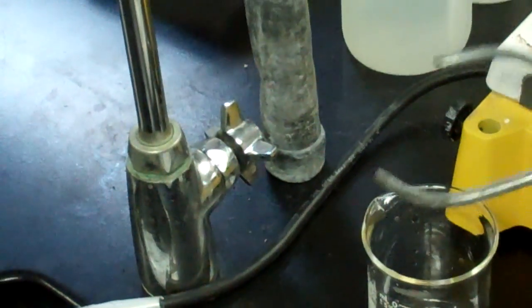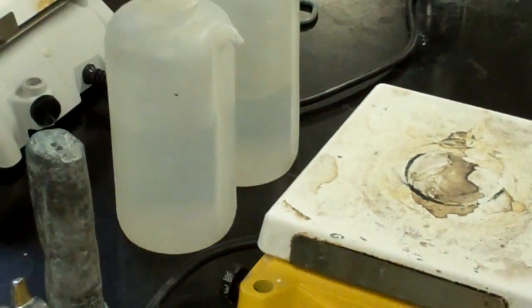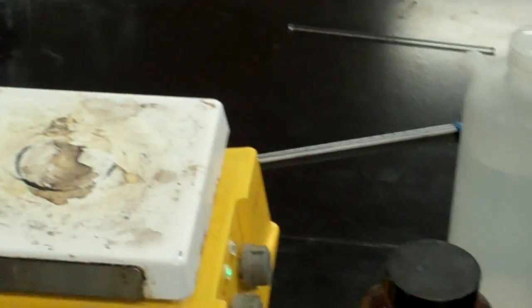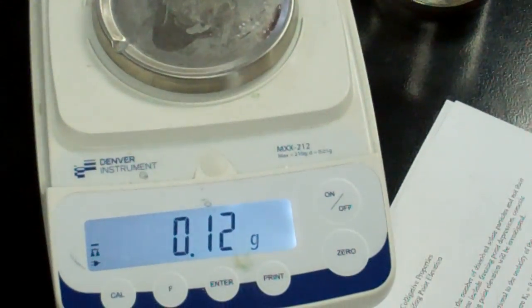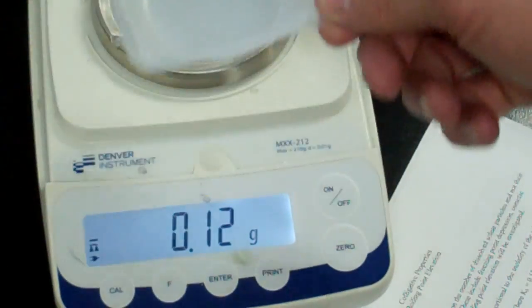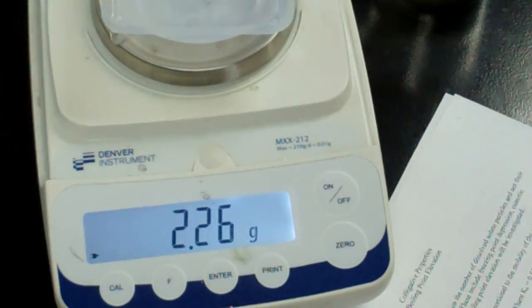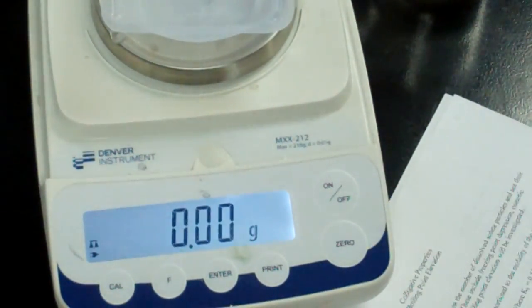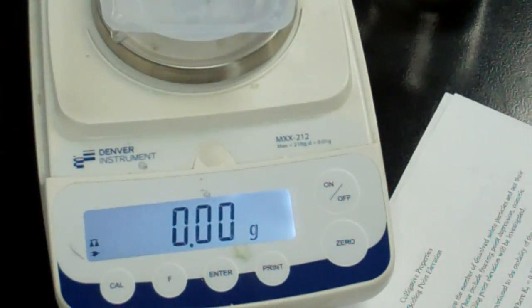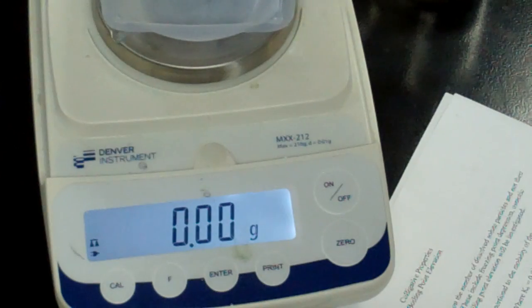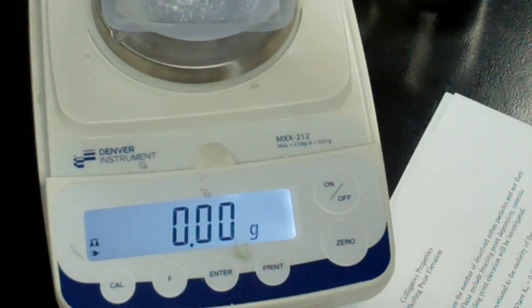Then you'll refill that beaker with 100 grams of water which we did already and this time you are going to add a solute to it. Now the solute you are going to use is sodium chloride. So here is our balance. We will use a weighing boat here and to use this we will press the zero button first. So even though that weighing boat is on there it registers 0.00 and we will add approximately 11.6 grams of NaCl.